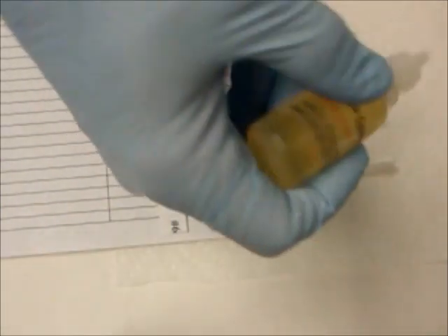After all the samples have been collected, wait 20 minutes from the time of the last sample which was collected, and then add one drop of reagent C, which is a color developer. You can wait longer than 20 minutes, even 24 hours, to perform the last step of adding reagent C. For example, you may want to collect all samples in one location and return to another location to perform the last step at a more convenient time.